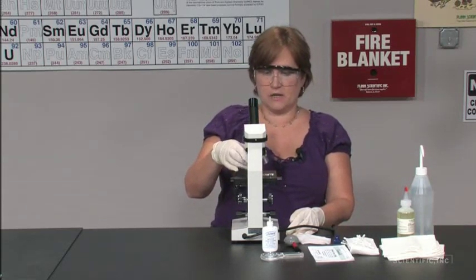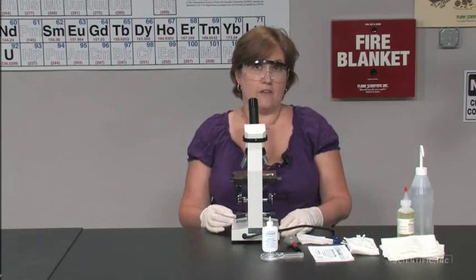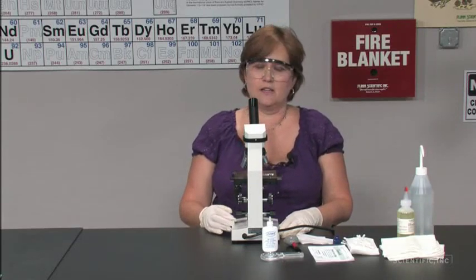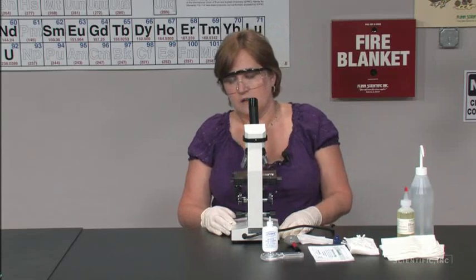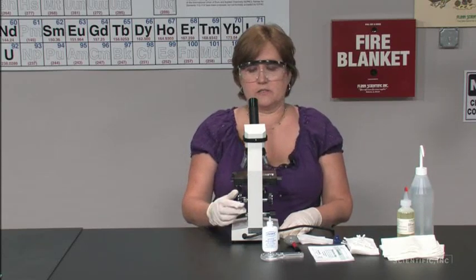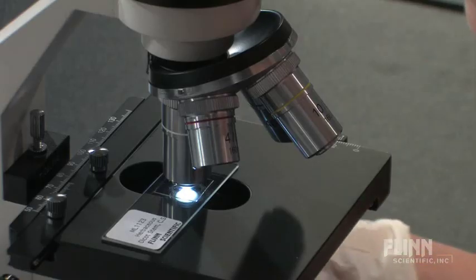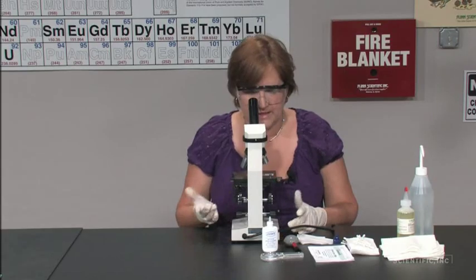Oil immersion, if your microscope has one, will undoubtedly have oil on it, although we tell students to make sure that they clean off the oil with each use. That doesn't always happen. It will also often have stains on it if you do bacterial studies. So once again, focus and make sure it's blurry.